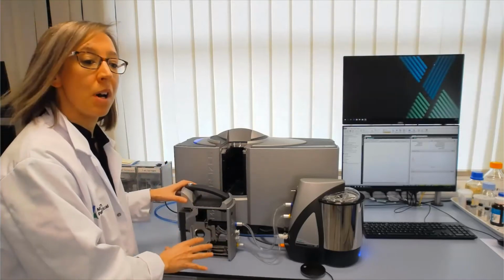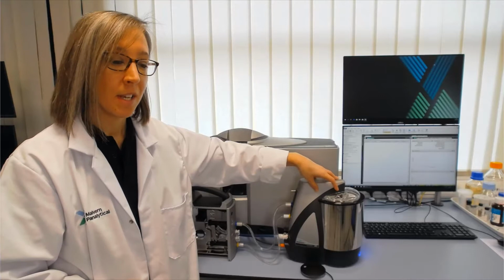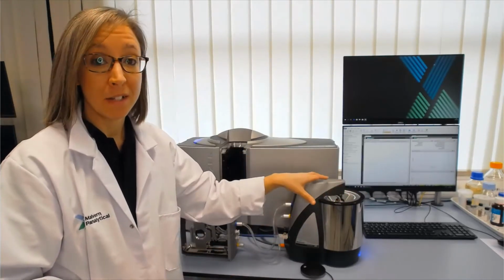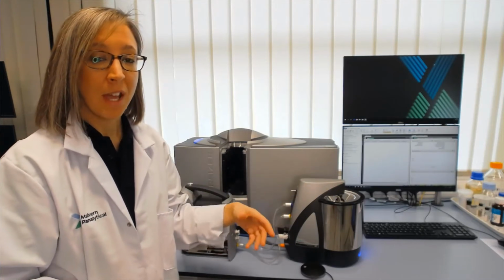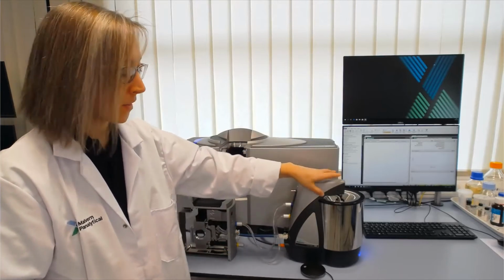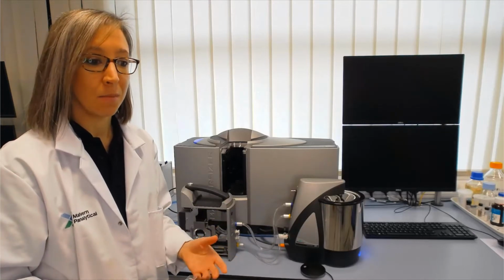The way we get the particles through the measurement cell is based on the dispersion unit here. This is the Hydro MV dispersion unit. It has a tank into which we add the dispersant, which will be about 120 mils. We've then got stirrers to suspend and circulate the particles, and ultrasound to provide some more dispersion. Once we've got this stirring, it will feed the sample through the measurement cell and have it passed back to the dispersion unit. So we have our sample recirculating in a nicely dispersed state.